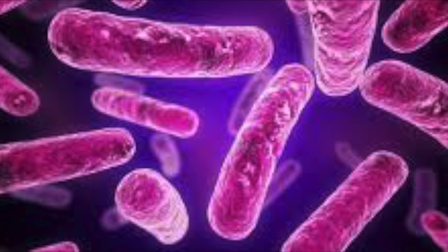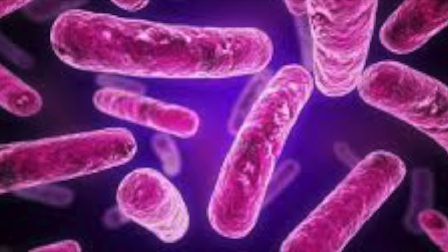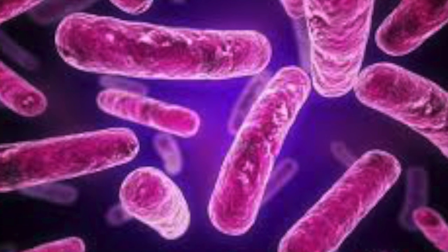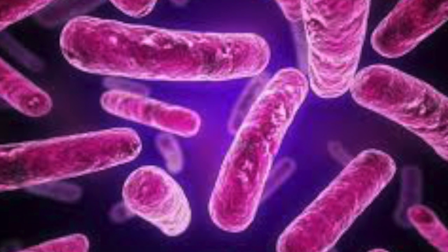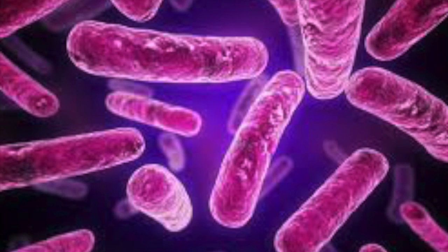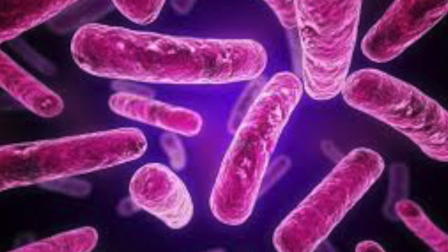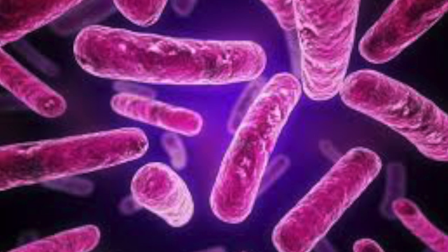We can conclude that Citrobacter freundii is a motile, gram-negative bacillus bacteria that is a facultative anaerobe, which tells us that it can perform aerobic respiration in the presence of oxygen, but it also has the ability to switch over to fermentation and anaerobic respiration in the absence of oxygen. We can back this up through the metabolic tests that were positive for sulfur reduction and sucrose, lactose, and glucose fermentation. The catalase test shows that the enzyme catalase can protect the bacteria from toxic byproducts of oxygen metabolism when the bacteria does perform aerobic respiration.